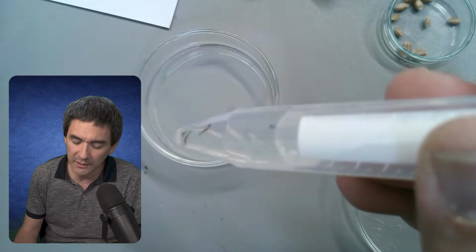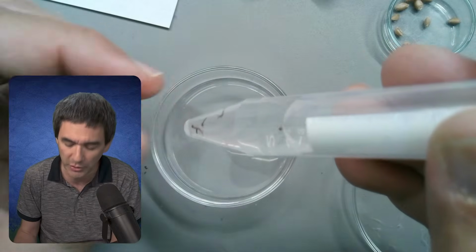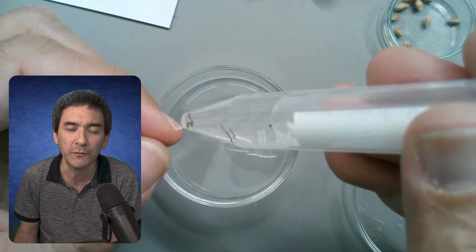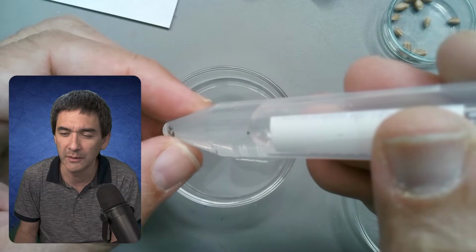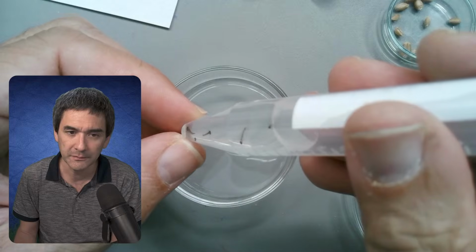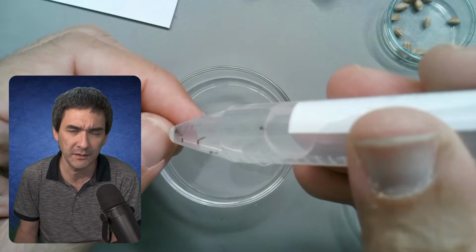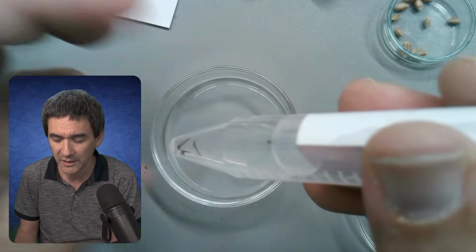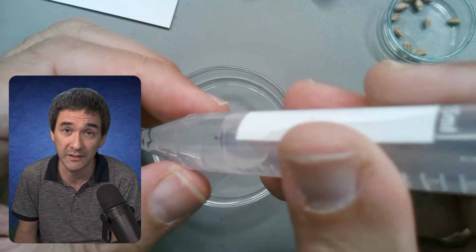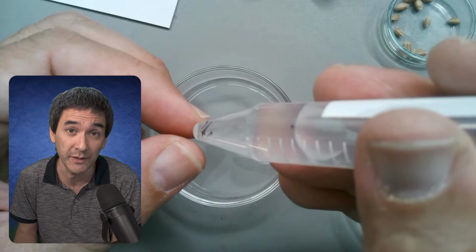What I would like to do later on is try to put them back into the tube here, and I hope that after a few days they will actually start to hatch. It could be mosquito or related. I will tell you the following. Strictly speaking, in some countries they're really strict about standing water. That's not permitted because it's a breeding ground for mosquitoes, and where you've got mosquitoes, you've got malaria.